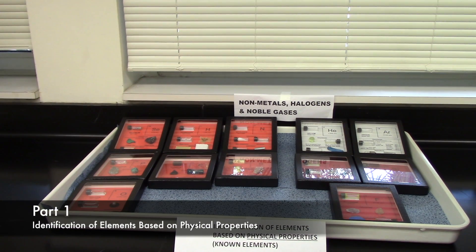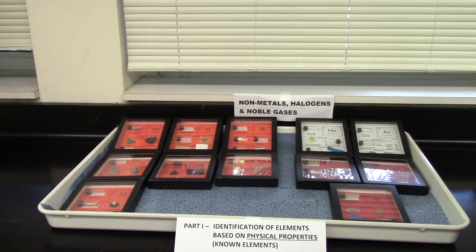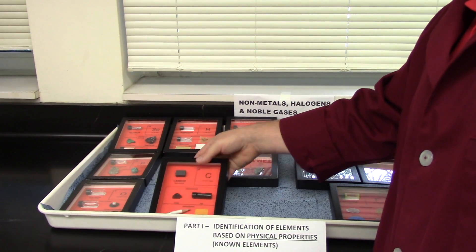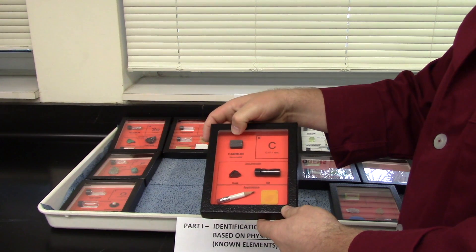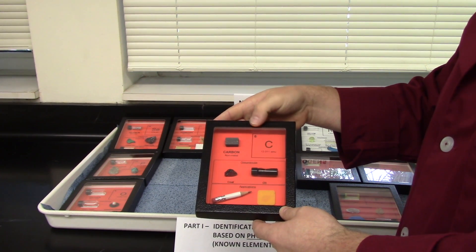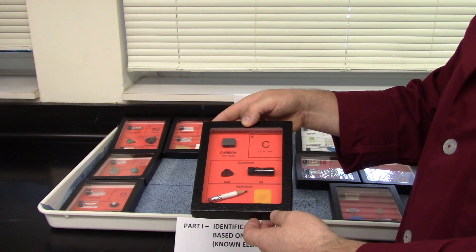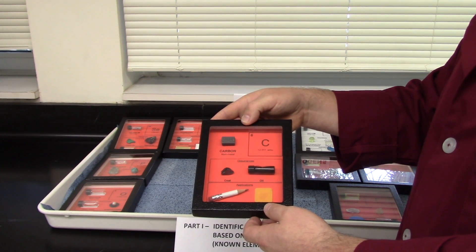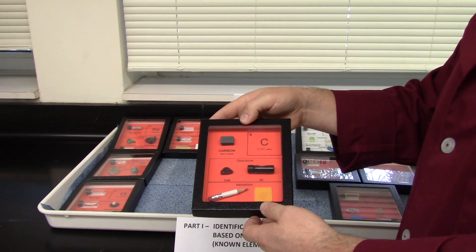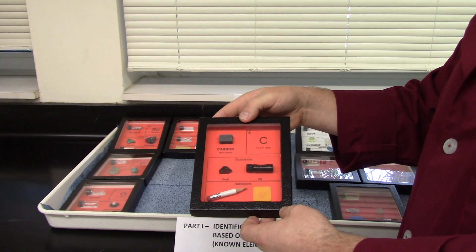Part one of today's experiment requires us to examine a series of elements, identify them by name, whether they are metal, nonmetal, or metalloid, and give a physical description. Let's take a closer look at one of these boxes — we'll pick carbon because carbon is my favorite element. This is what the element carbon looks like. In your notebook you'd want to write down: this is carbon, it's a nonmetal, and for a physical description I would say it appears to be a black solid. When you're done with the element box, please place it back in the tray where you found it.